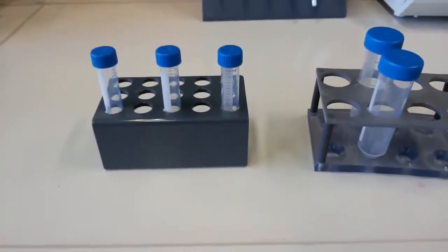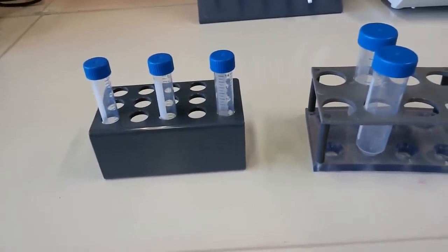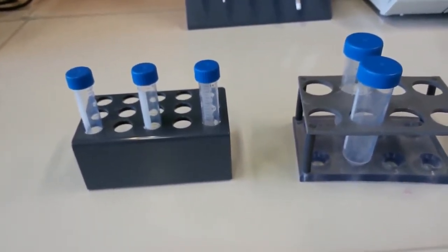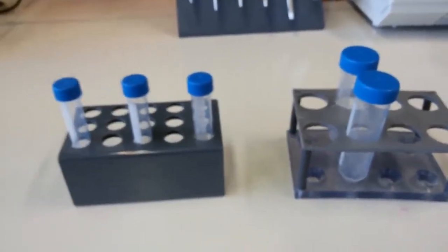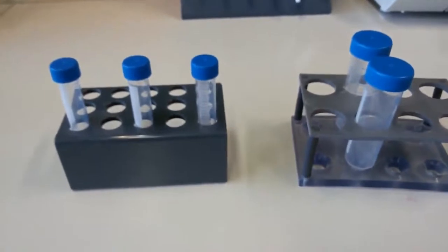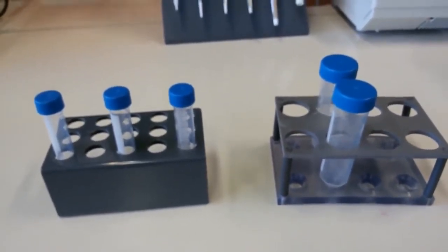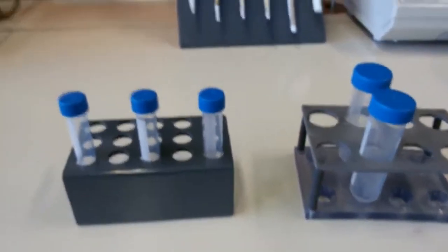It's just a short reminder: the rest of the things that I showed you before, you cannot use and throw. You use them, you wash them, and you make them sterile using an autoclave, then you reuse them. For these tubes, it generally depends on the lab. Some labs prefer reusing them, since they are autoclavable. But in my lab and for most people, they don't prefer to reuse them, so they use and throw them. Great.